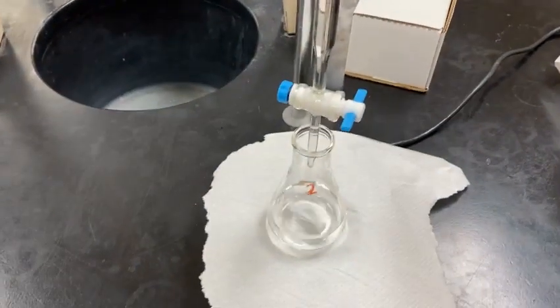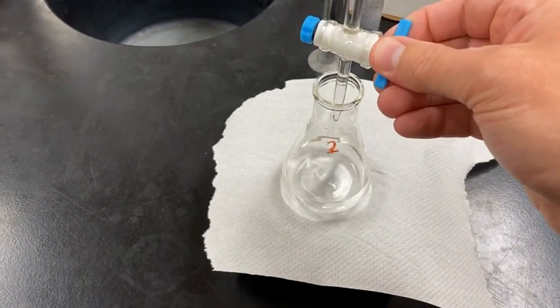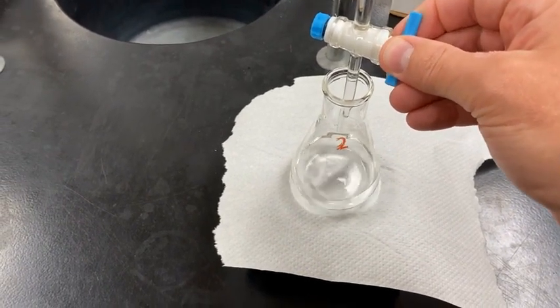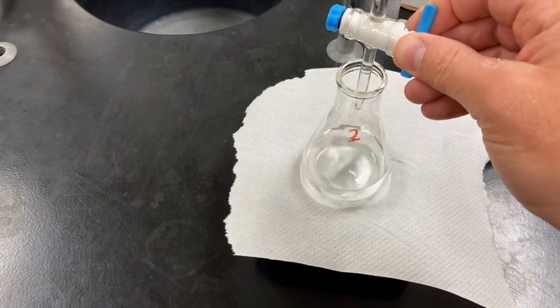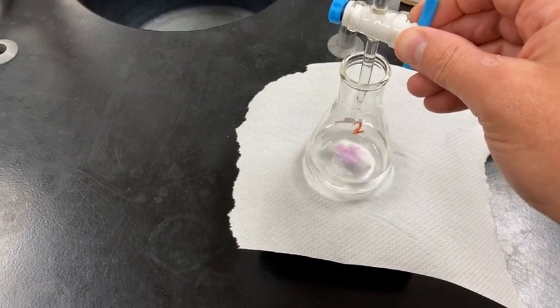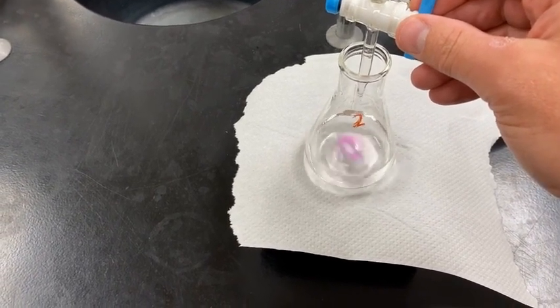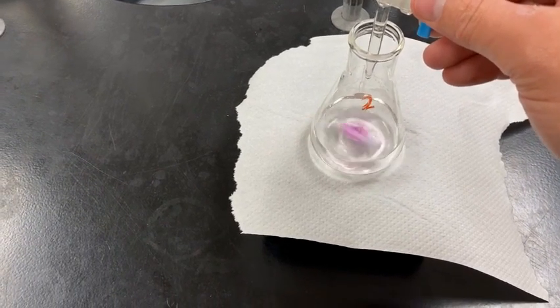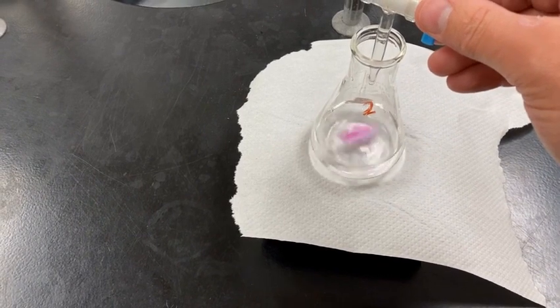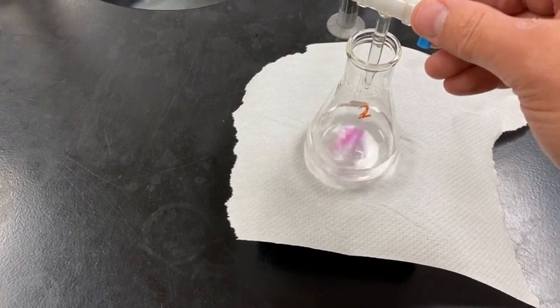And let's titrate. So we know just about how much it's going to take on this trial. Now, I did have a little bit less of the solution on this trial, so it'll probably be even less. So I'm going to take my time with this one again. Try to get that nice light pink. Start with a rapid drip drop. Nice alliteration, I know. And then when it starts to persist, we'll slow it down.